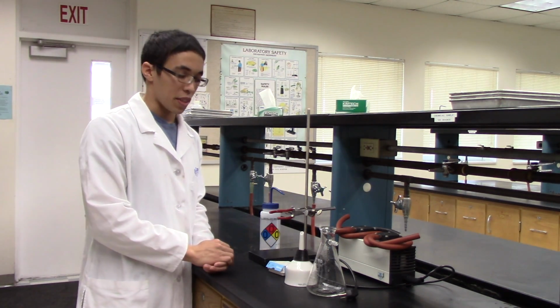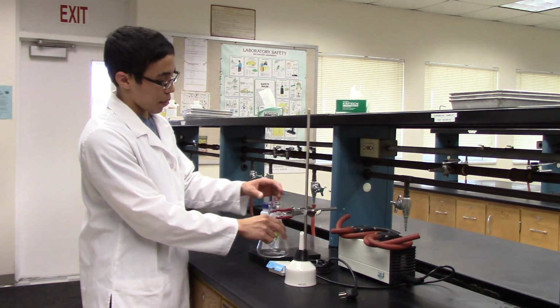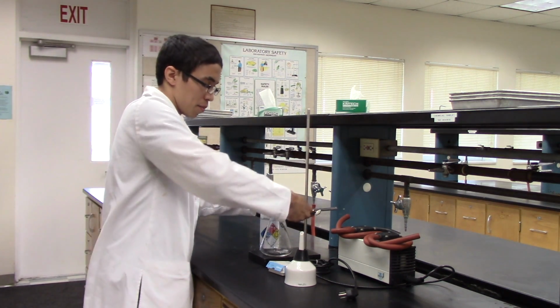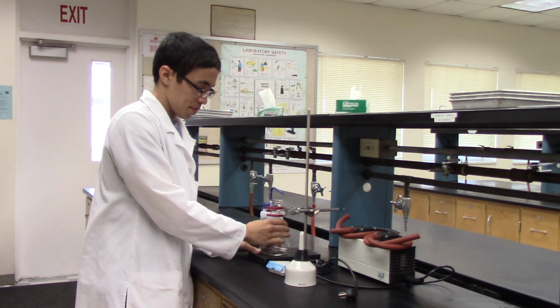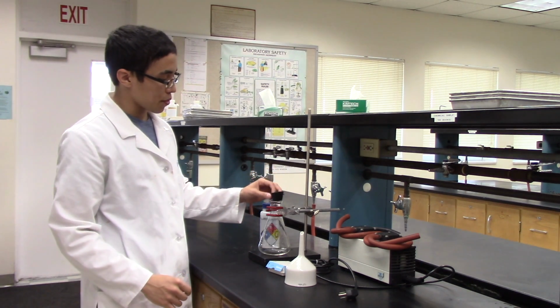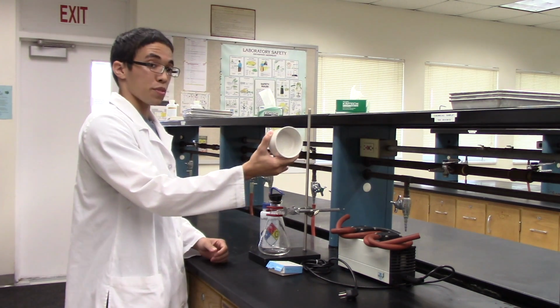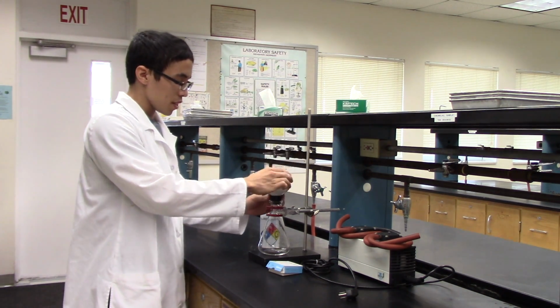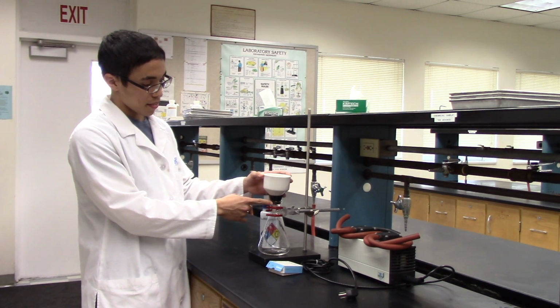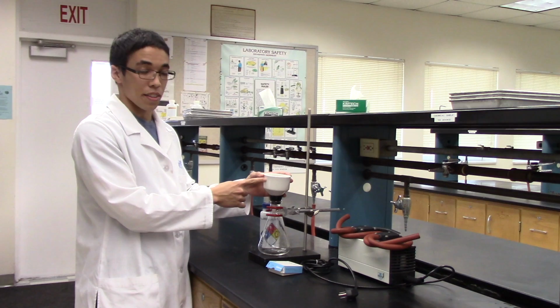To do vacuum filtration, you will first get your filtration flask and clamp it in. Make sure you clamp it in nice and tight because it might move during filtration. You will then place your concentric rubber stopper on your filtration flask and then the Buchner funnel on top. Remember, glass to rubber and rubber to glass is a good seal, but glass to glass is not a good seal. You want a good seal here.